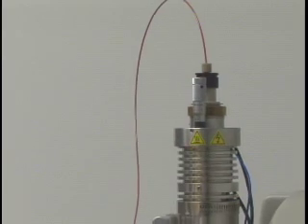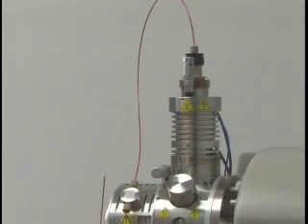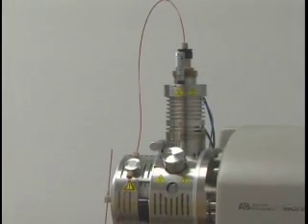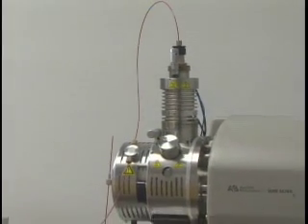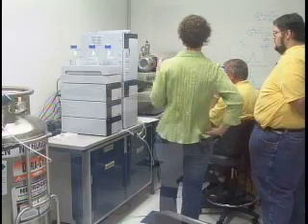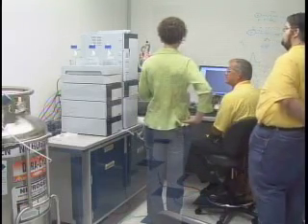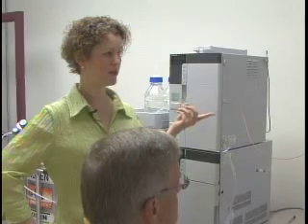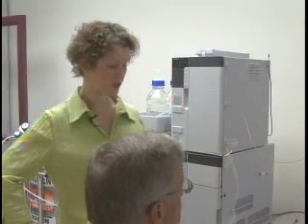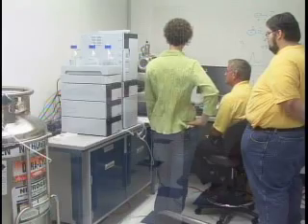You can also adjust the electrode itself with this union, which lets you retract or extend the electrode. All of that depends on the conditions you're running in the system at the time. Regarding the vacuum system: this piece of hardware has a turbo pump on the inside and a rough pump that goes with it — it is a two-pump system.